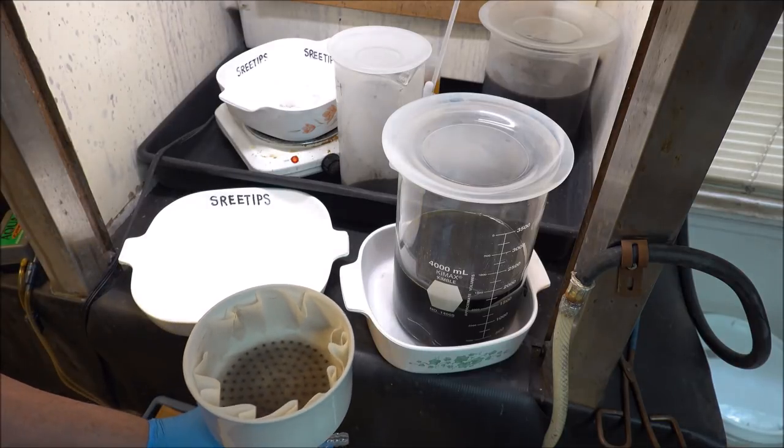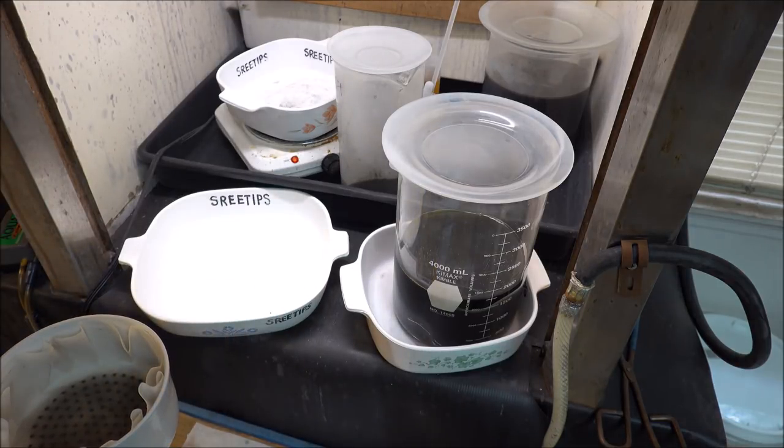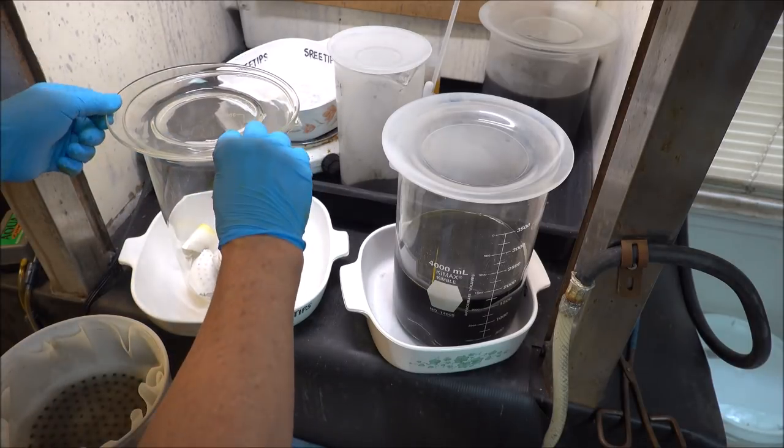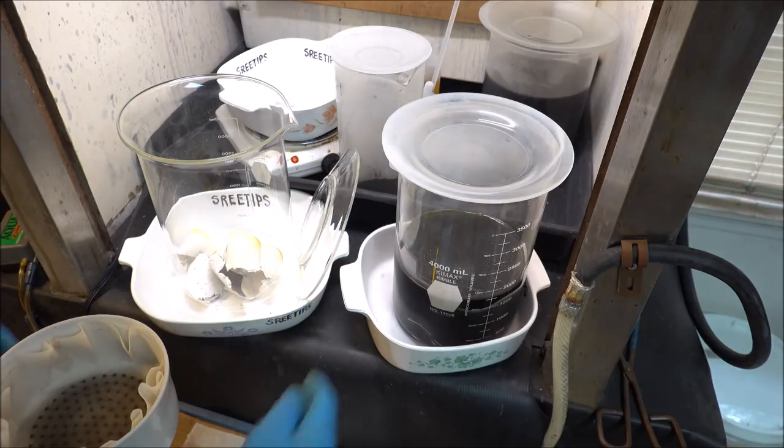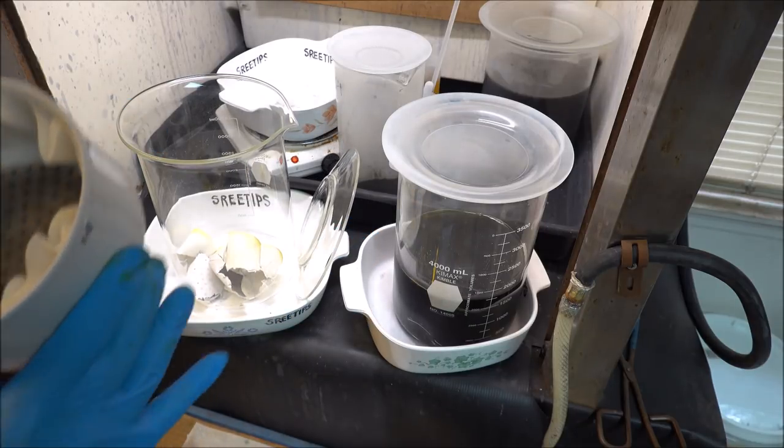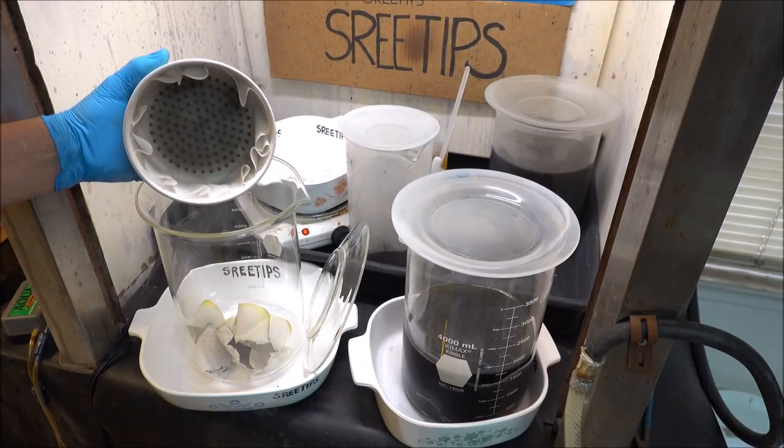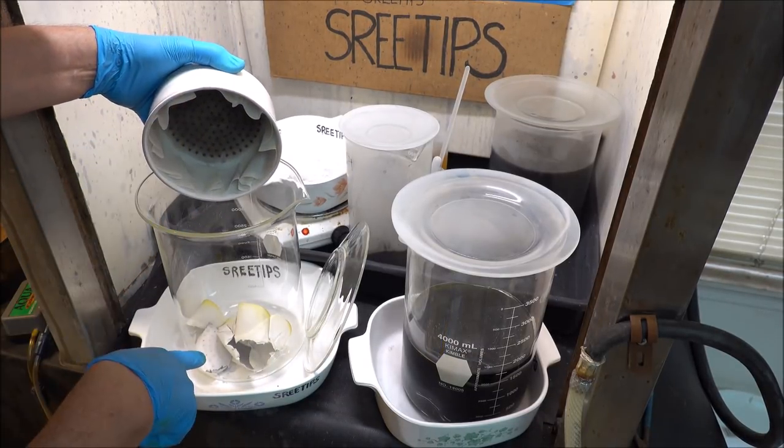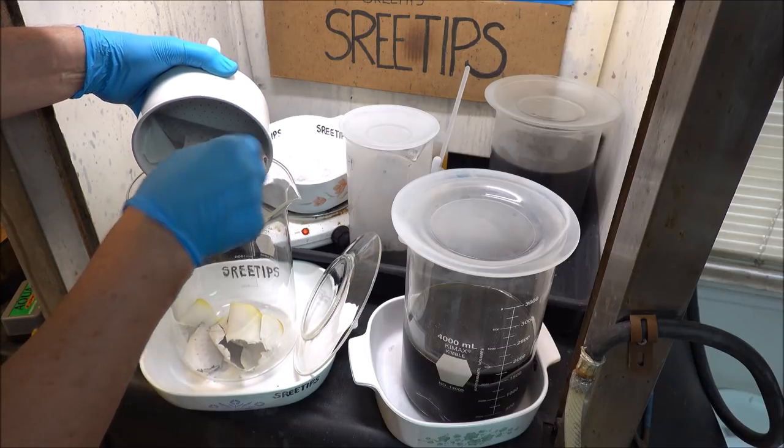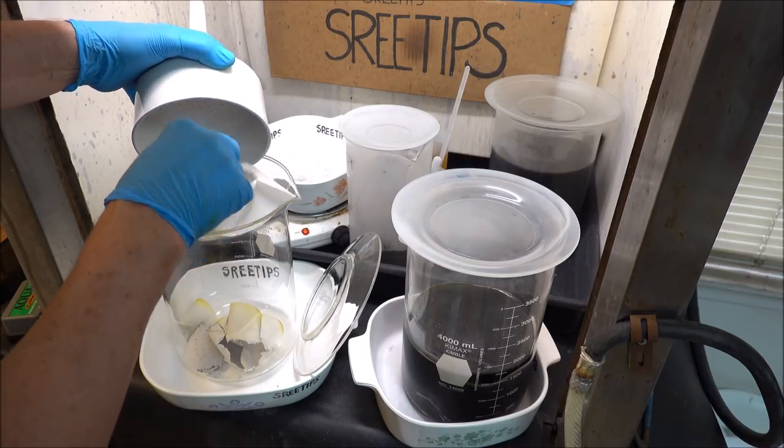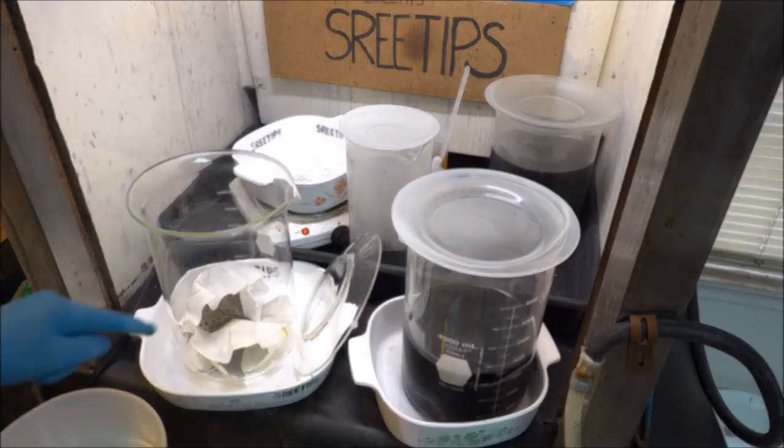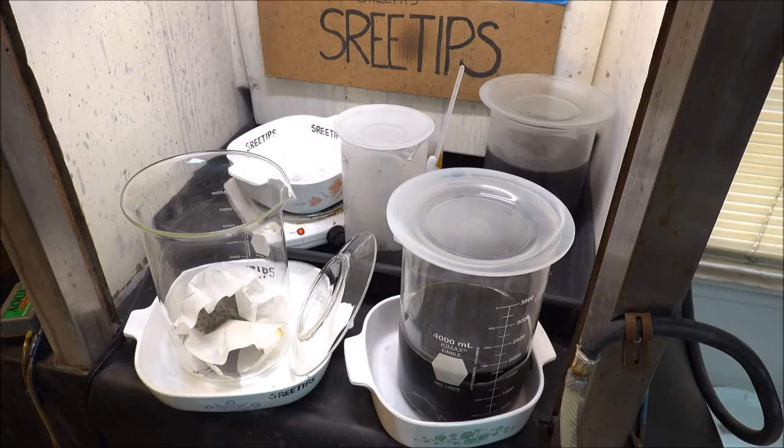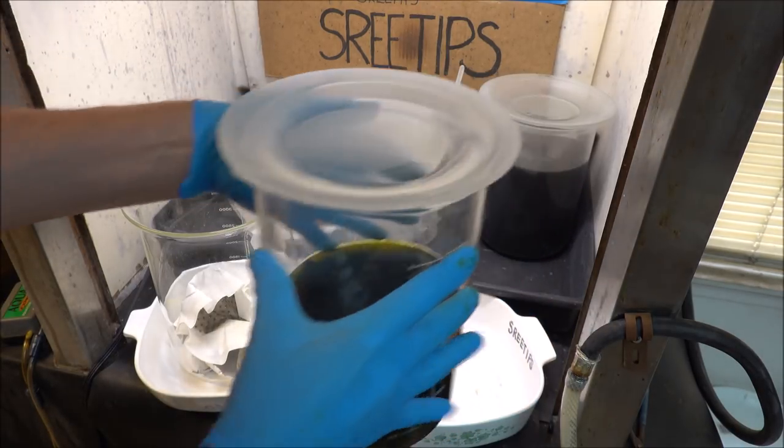There's been some folks complaining about the length of the videos and the repetition that I put in these things. But in order to make it make sense as to what I'm doing, I try to include as much detail as possible in these videos. I'm adding this material out of this filter to the other filter because I don't know what's in this filtered material. I'll be using this as my reaction beaker. I'm going to remove these two solutions now. These are going to both be waste solutions.